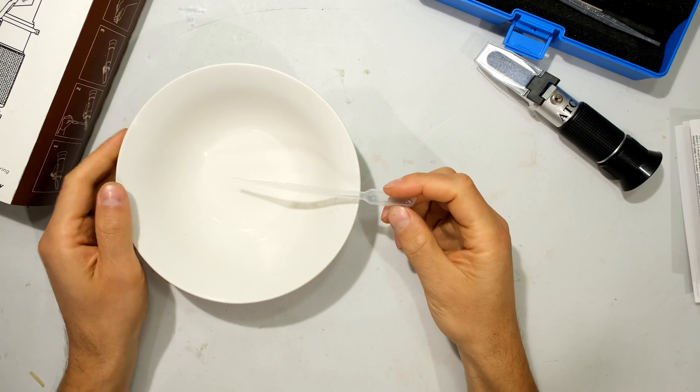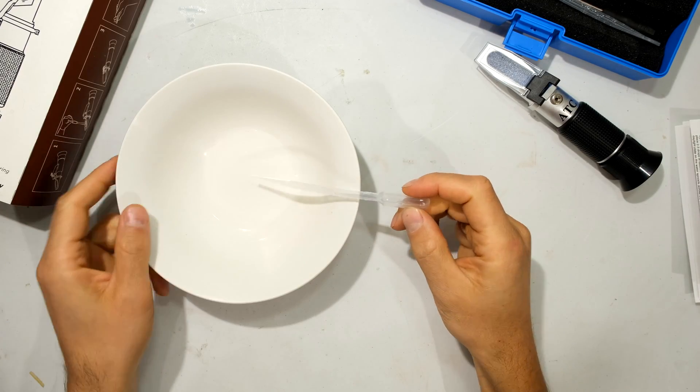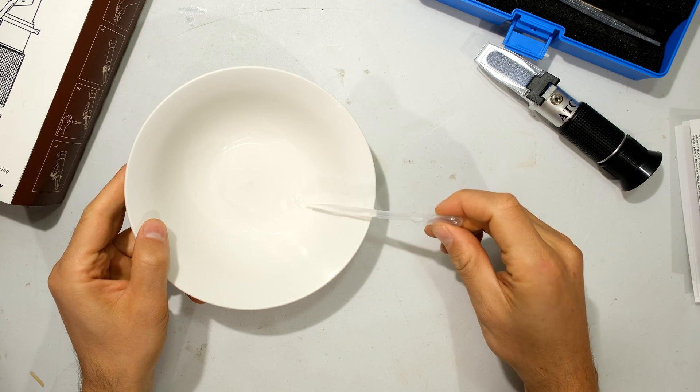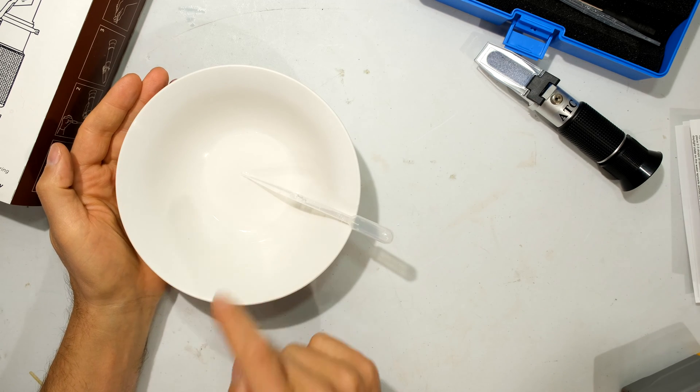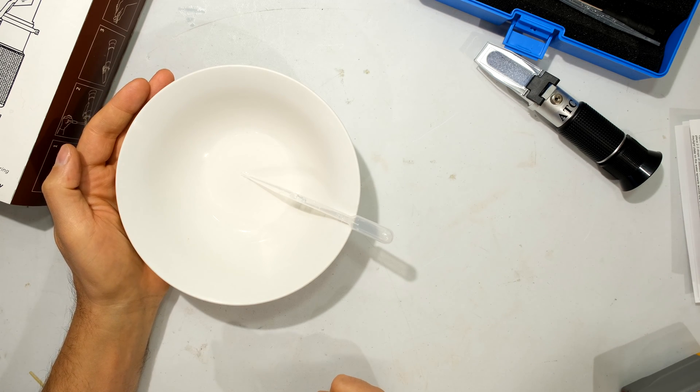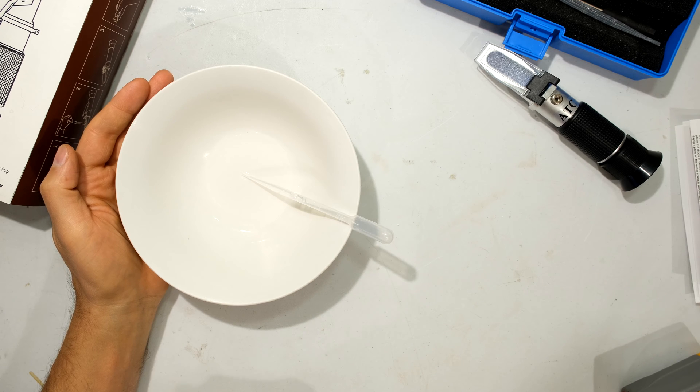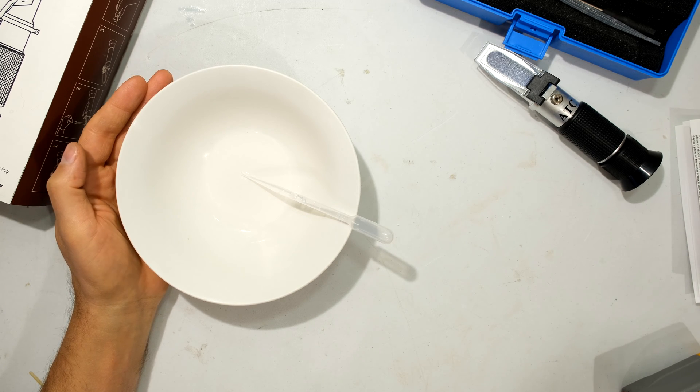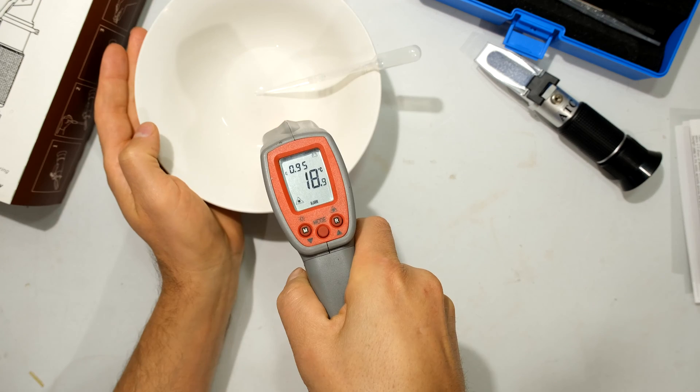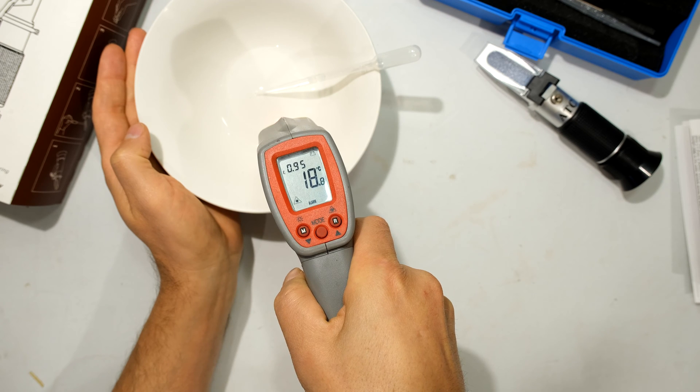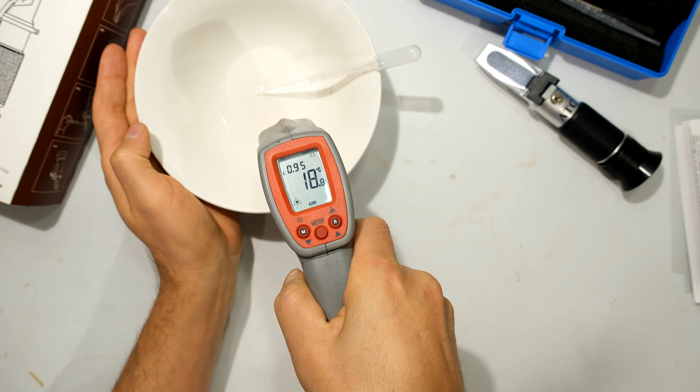Make sure your dropper is clean. I've got my distilled water poured in this bowl. Alright, I've left this water out. The reason being is the ambient temperature influences the calibration measurement. So you can see the temperature of the bowl is 19 degrees centigrade.